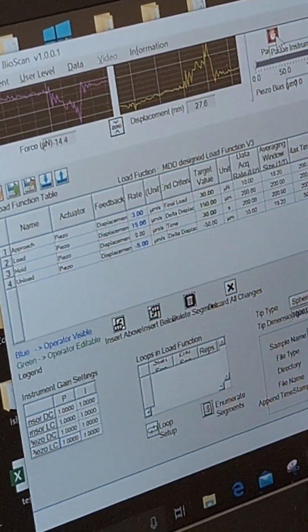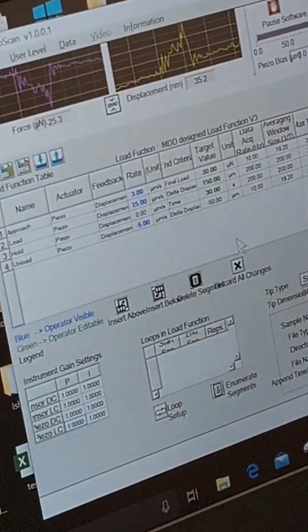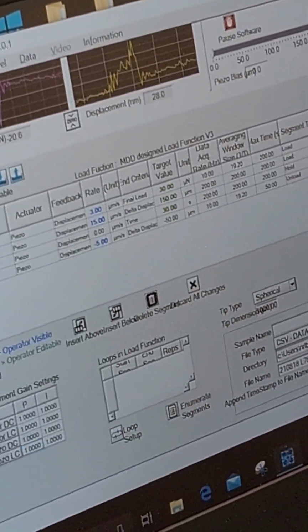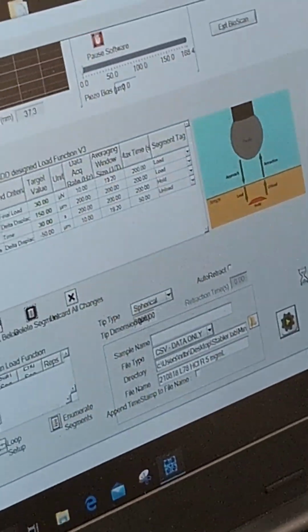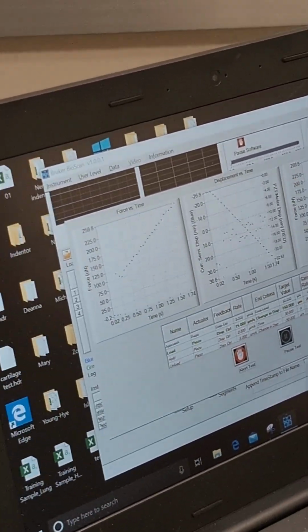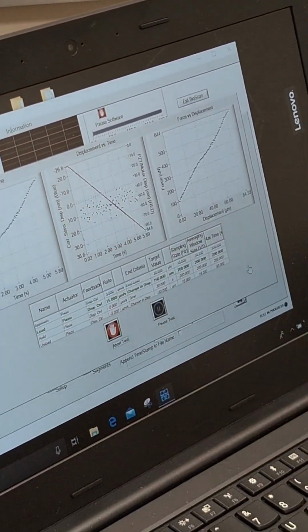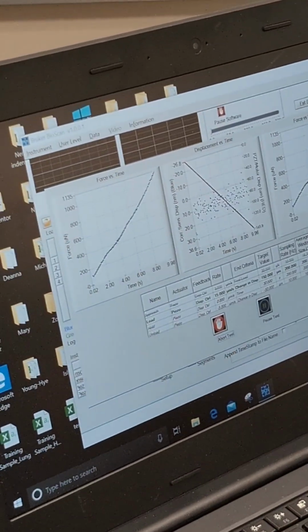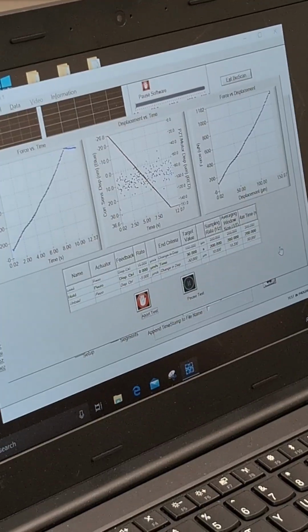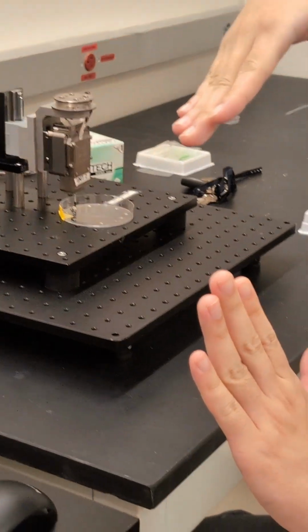This is something that you may have to play with additional, just to do the testing. So what I'm going to do now is just go with it, see how it works. Okay, now it starts to indent. So this is the force of indentation. So it goes further and further. When it stops, you will see a classical trend going down.